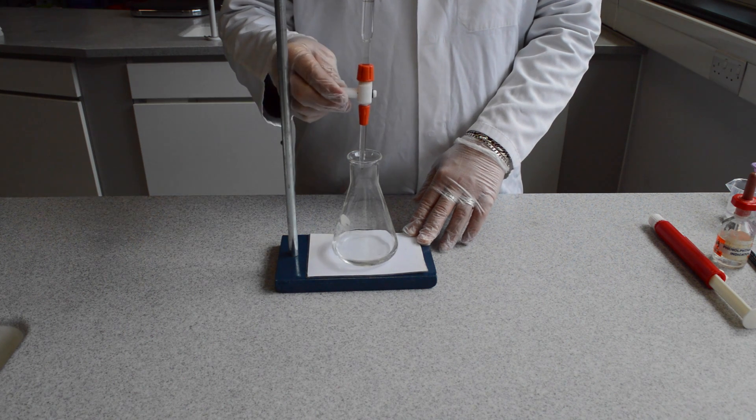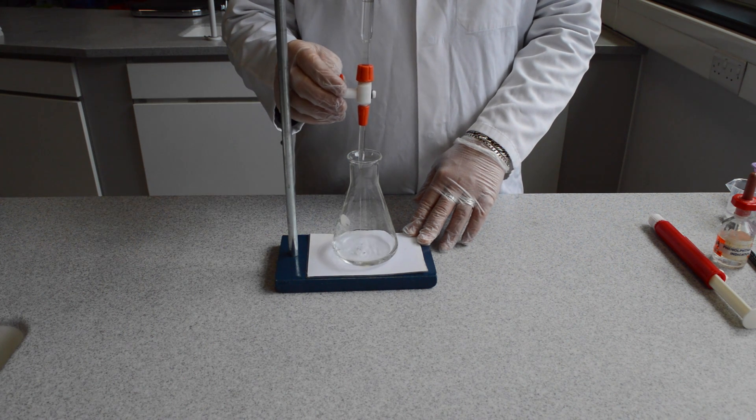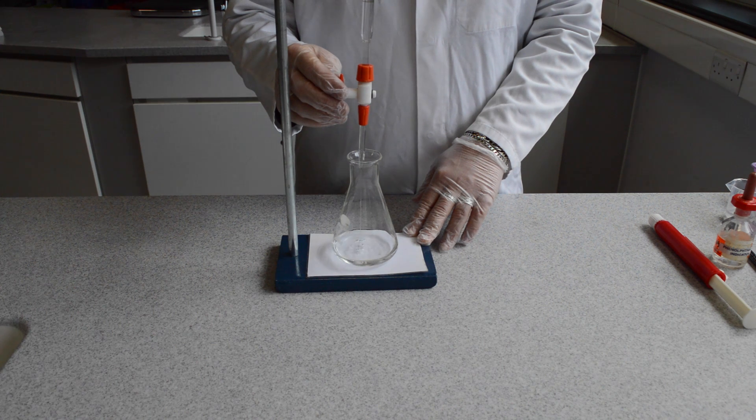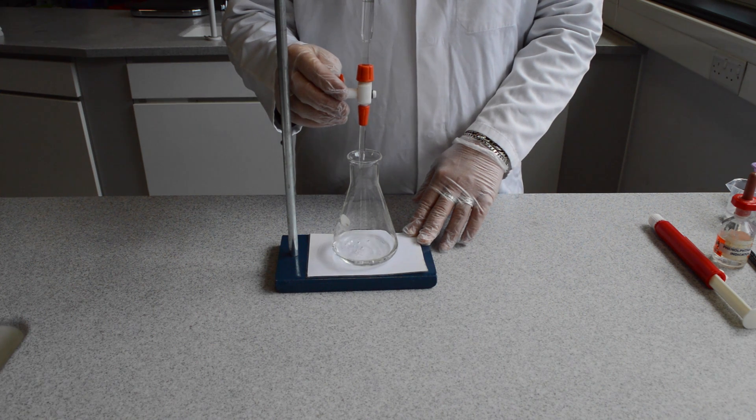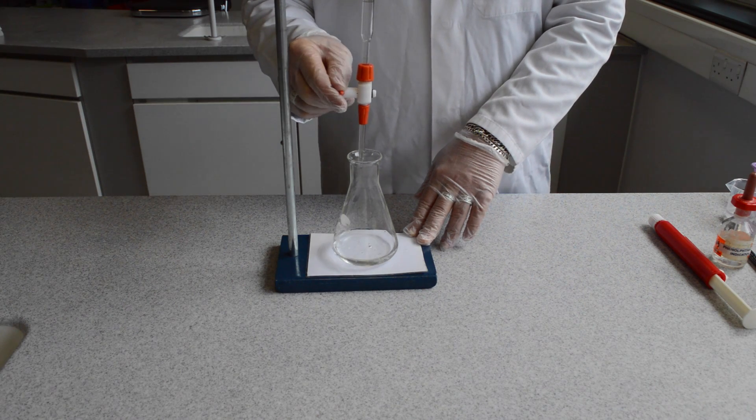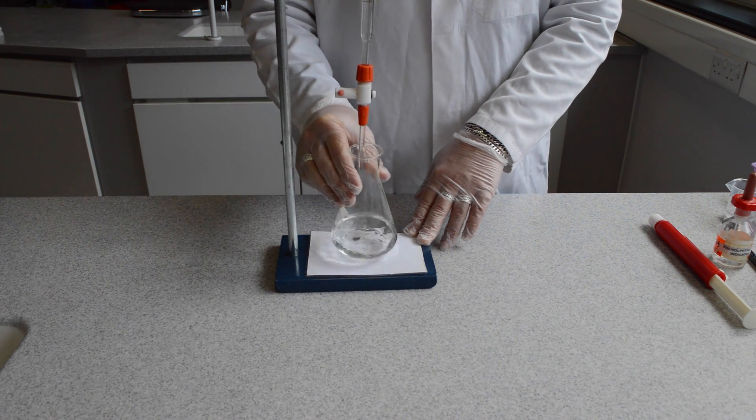This is done small amounts at a time. After each amount added, swirl the flask to mix the contents.